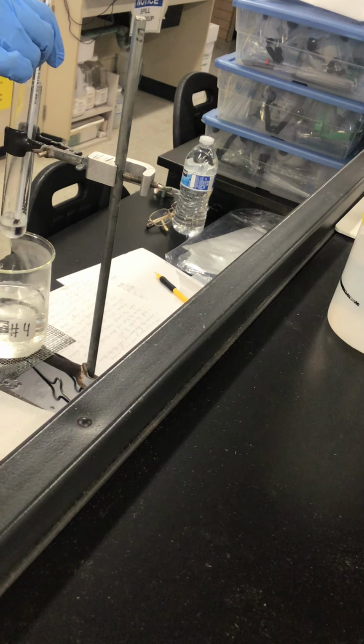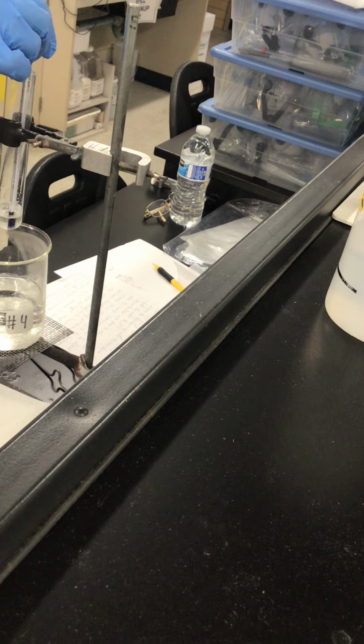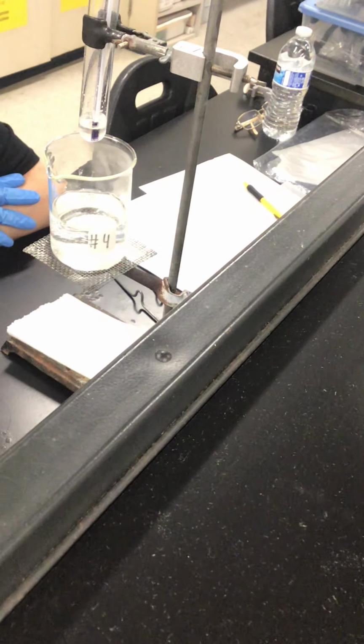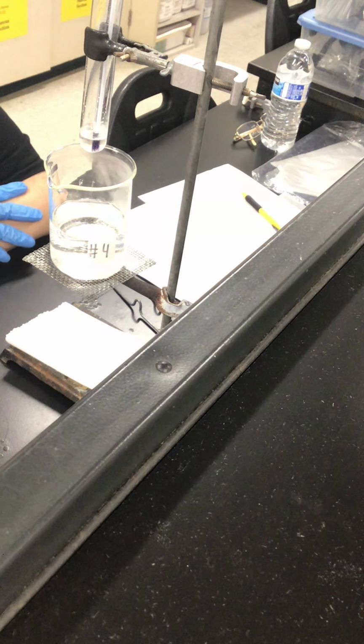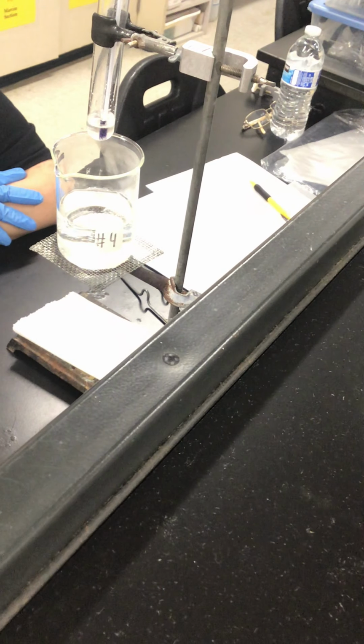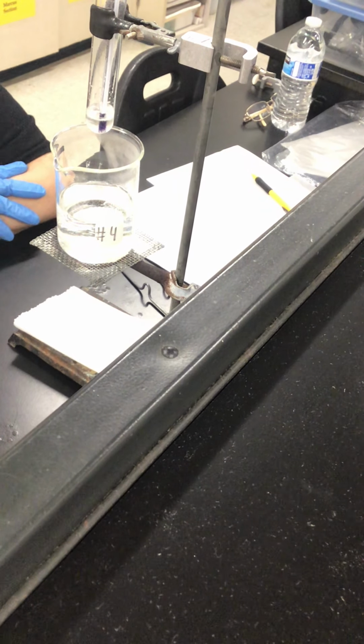You're going to have a plateau sometimes. 43. 43.